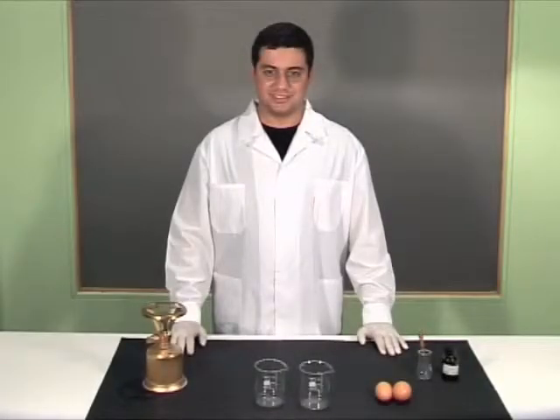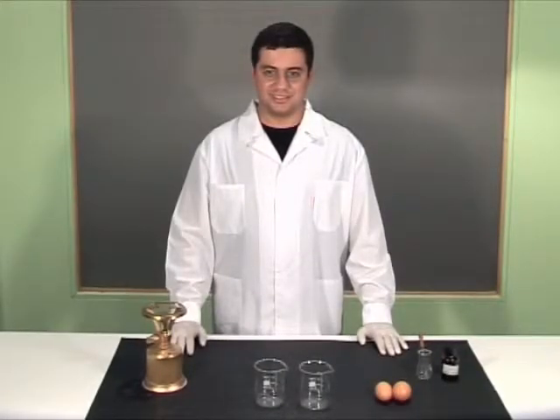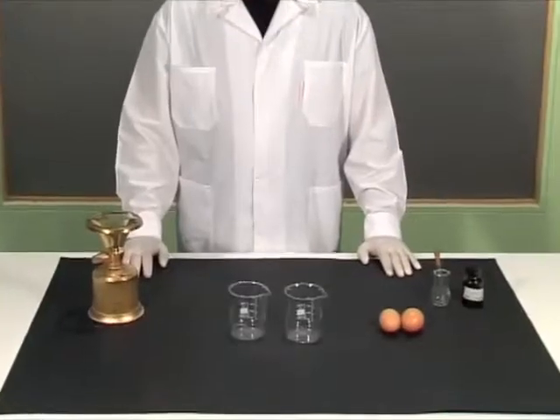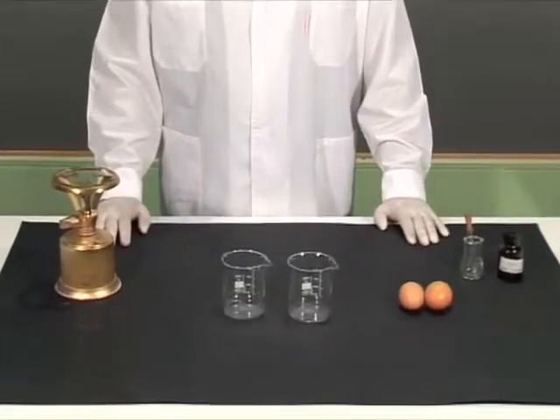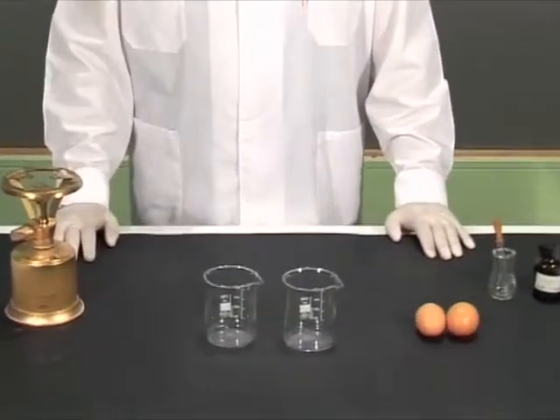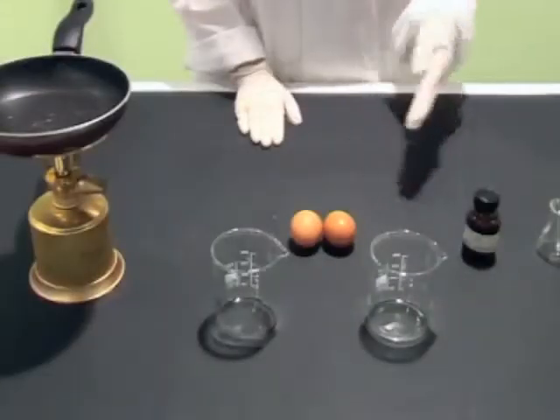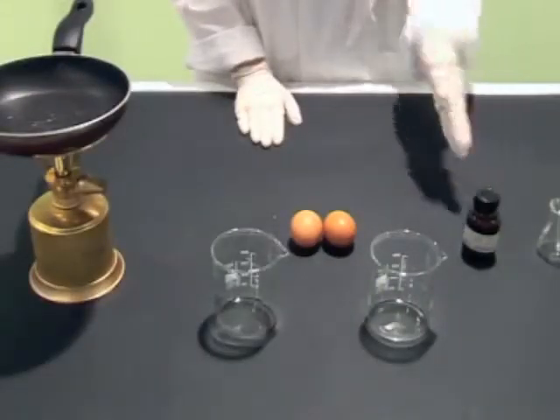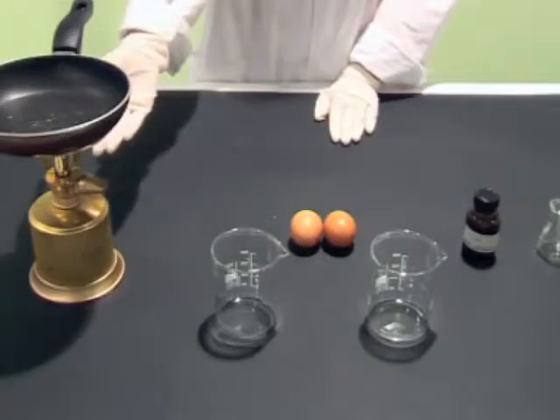Altering the structure of protein. We are about to demonstrate how the 3D structure of albumin, a protein of the egg white, gets altered when exposed to extreme conditions of acidity, known as pH, and temperature.